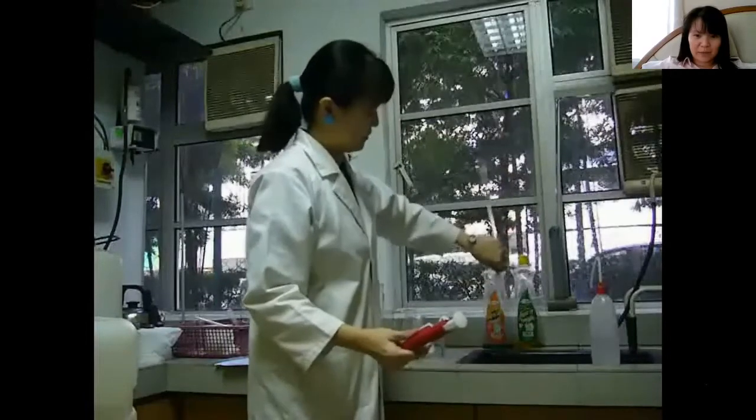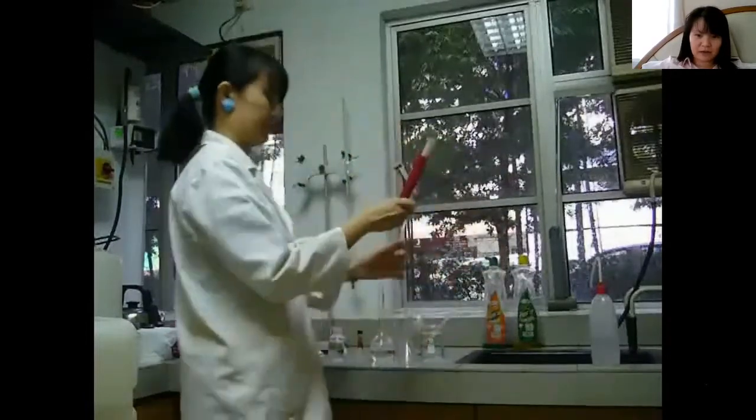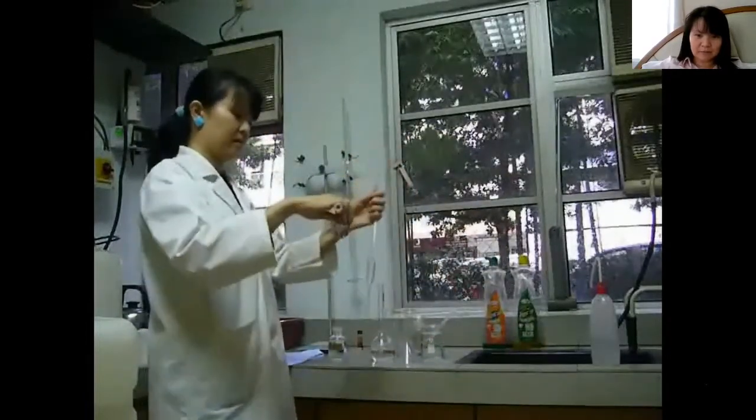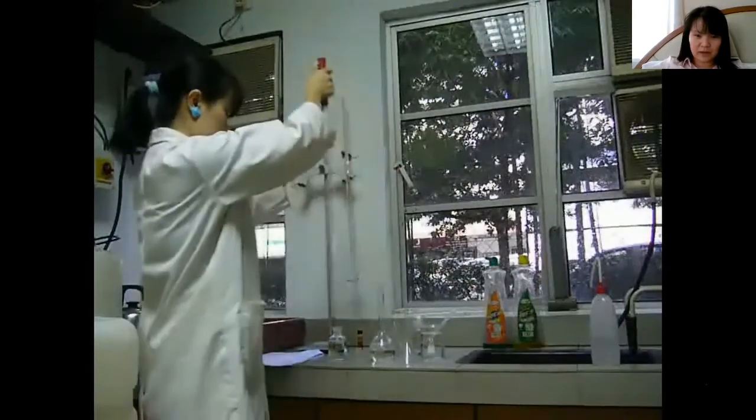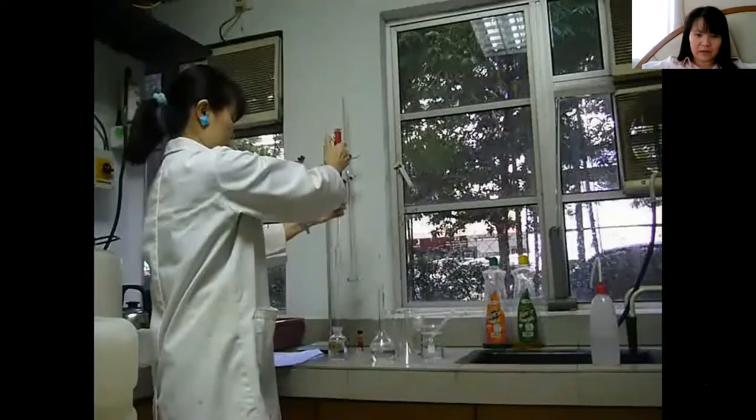And now that the pipette is rinsed with the alkali so it's clean, doesn't have extra moles of water in it, now we can fill the pipette with the alkali.